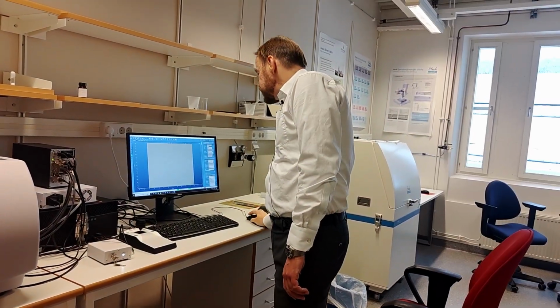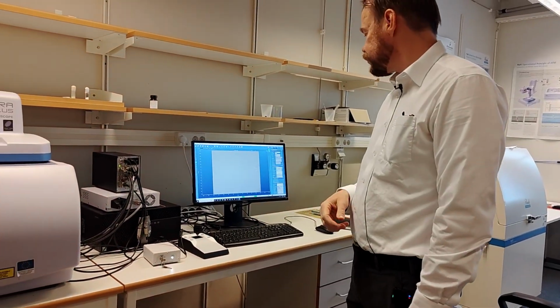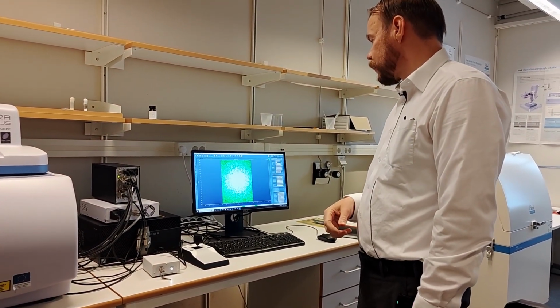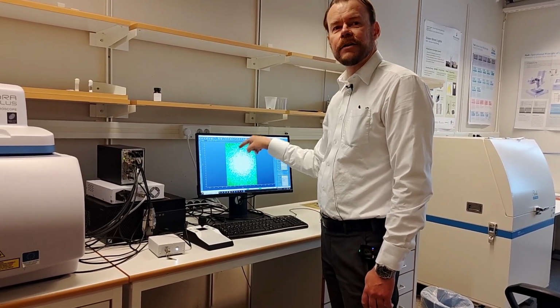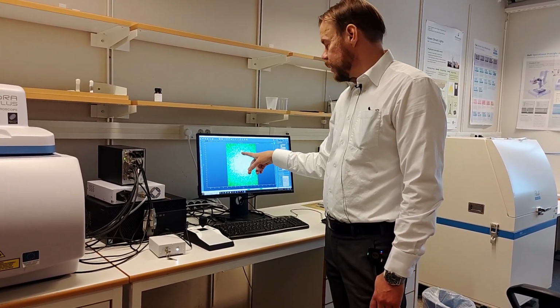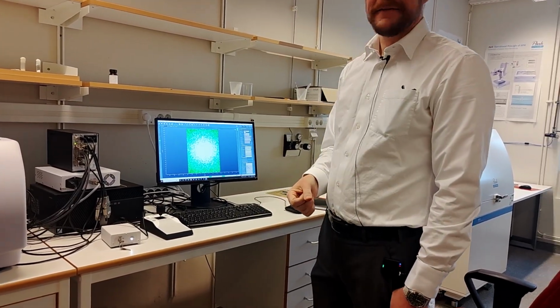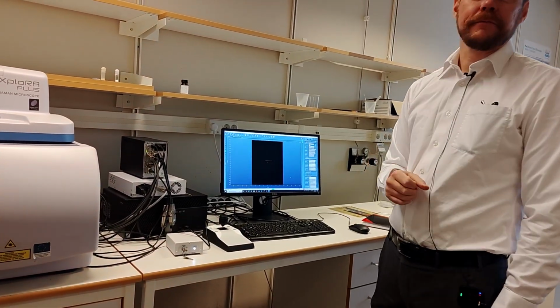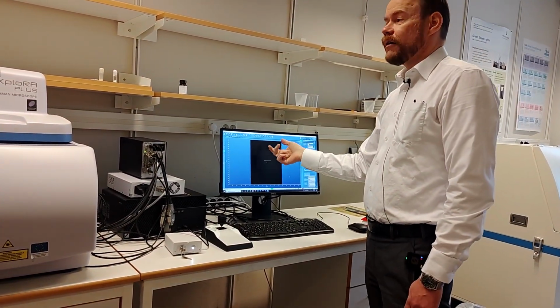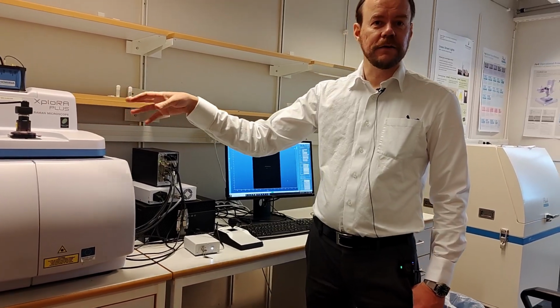So if I switch to the internal camera here, you will see this change. And then you see the green stuff here. This is actually the laser light hitting the camera. And that's the reason why I put 1%, because if you have 100, it will be all white. So if I turn off the laser now here, you see it's black. So this means, okay, the laser is on, we have the laser all the way through the spectrometer and so on.